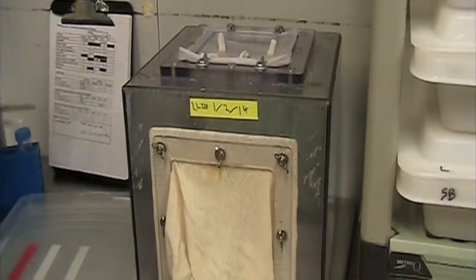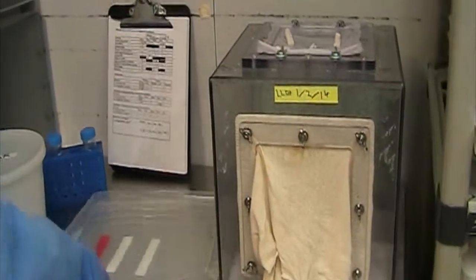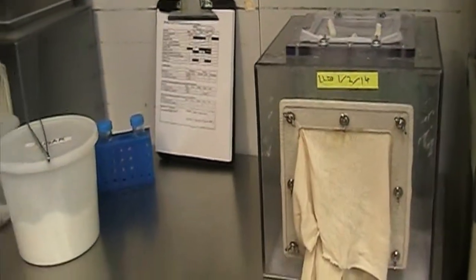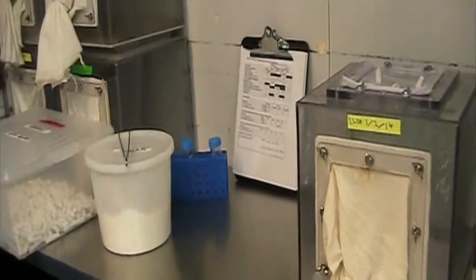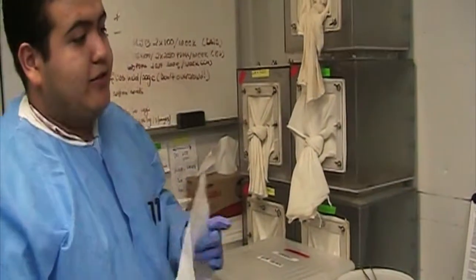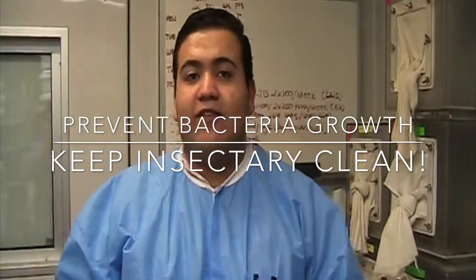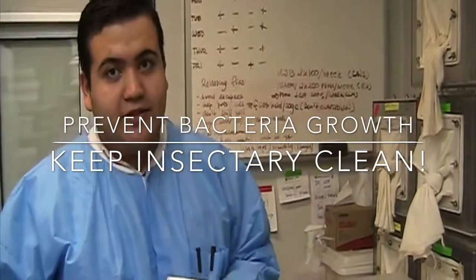You want to put the sugar cords all over the cage. One of the next steps is to give sugar to the colony that's already potted up. I'm going to show you the incubator where we keep them and how we give sugar and maintain the colony clean. One of the important things here is that we maintain everything very clean — we don't want any bacteria getting on the pot. The first thing I do is go inside the incubator.